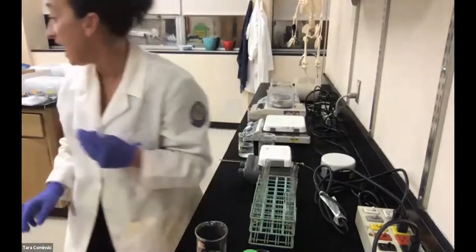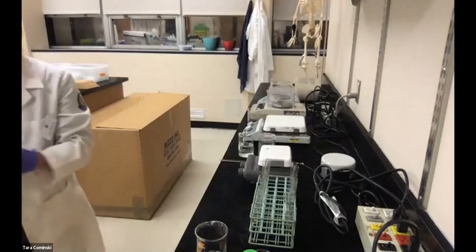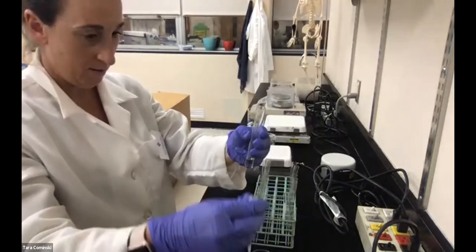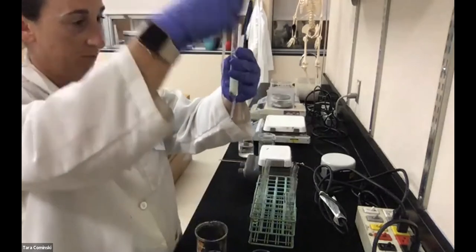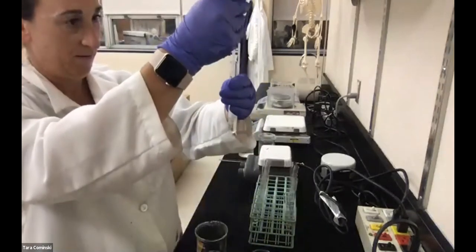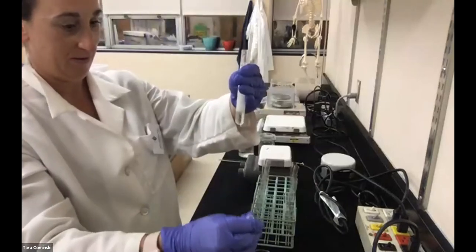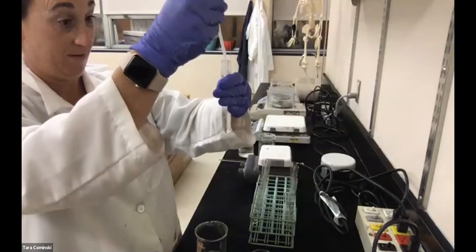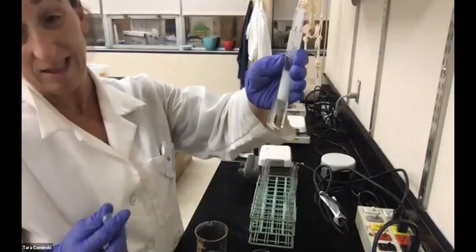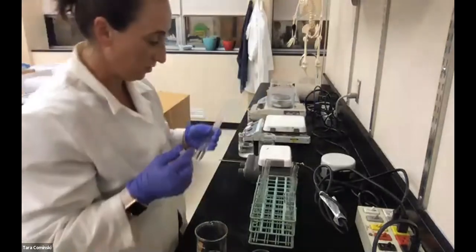And then we're going to go with tube 3, which is pH of 10, and see what we got there. Let me just pull directly out of the bottle here. Based on this, it looks like definitely the bubble height is higher. So I'm going to call this bubble height about 50 millimeters. So the pH 10 was about 50 millimeters.